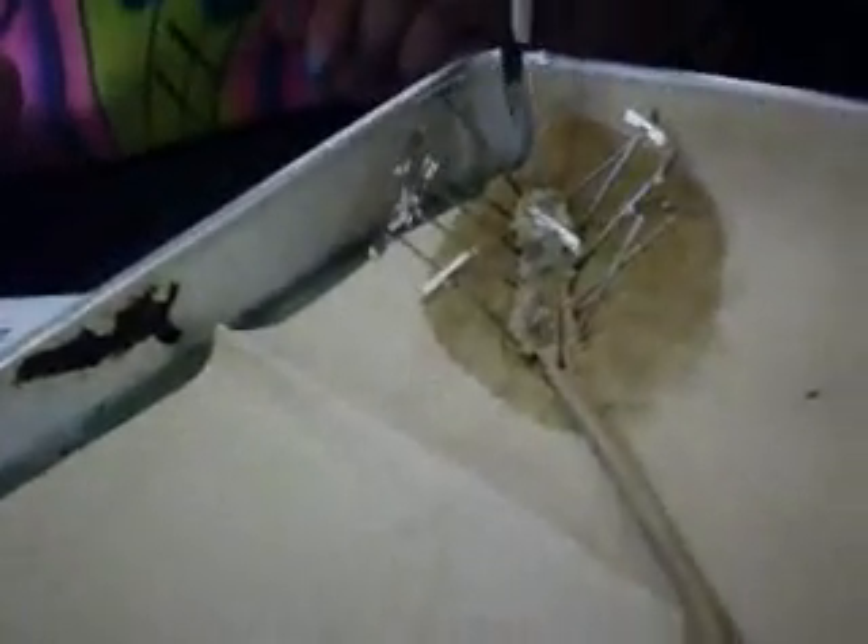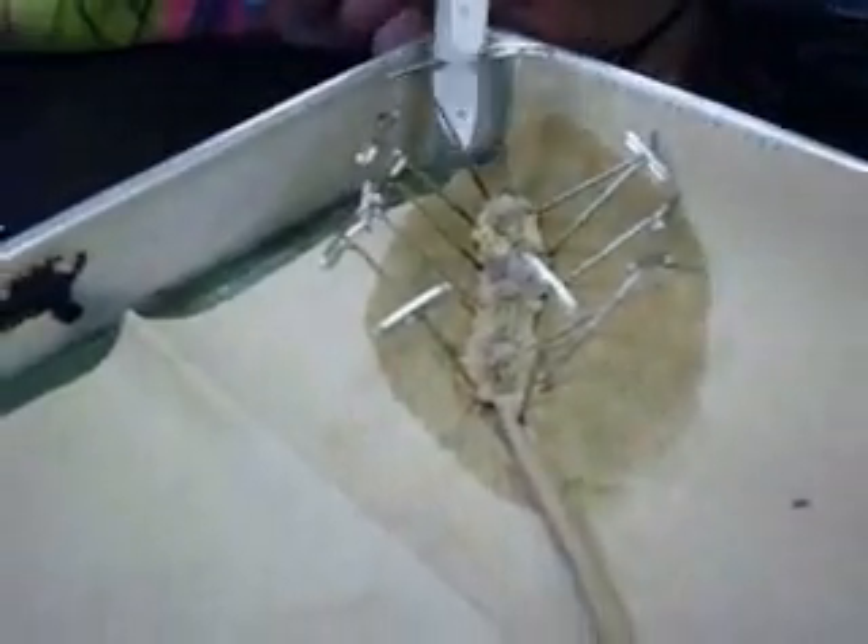Where's the brain? Do they have a brain? It's teeny tiny. It's the cerebral ganglion right here. Is that it? I think that's it — it says that's the cerebral. I guess that's the brain. The brain's bigger than I thought it'd be.